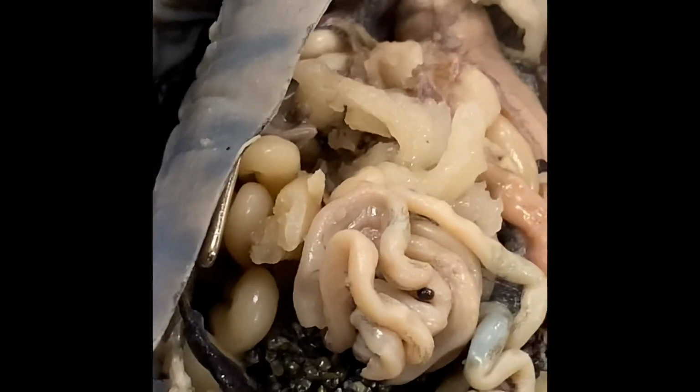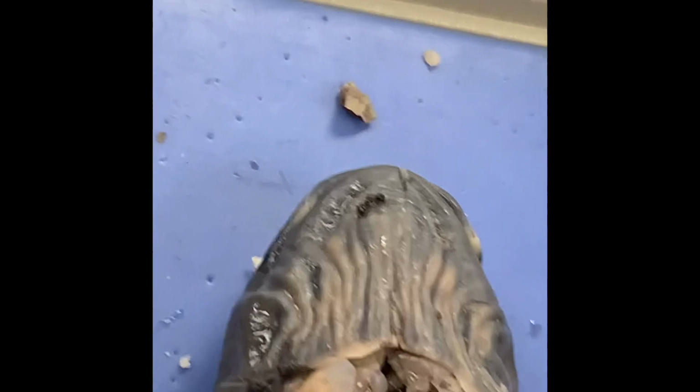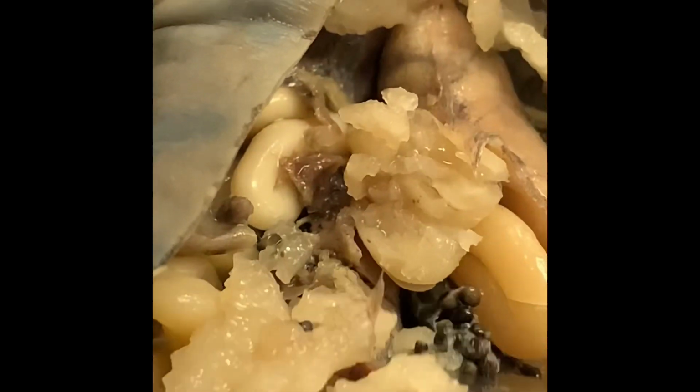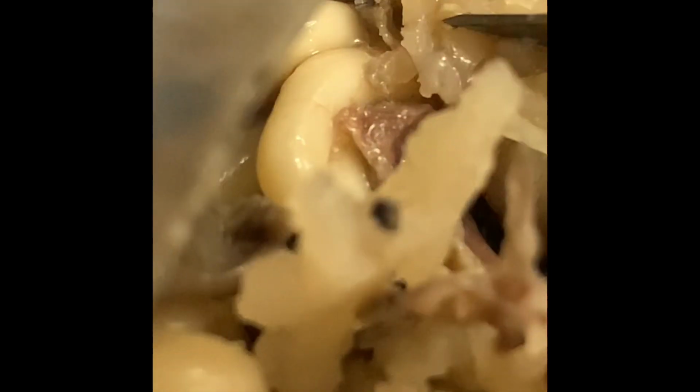You see, like the little... It's like a little brown thing next to the stomach will be the spleen. You can kind of just point anywhere. And here, you point at it with this. So the spleen should be right... See this little brown bit under all the intestines and ovaries. You might not be able to see it that well. Wait, no, I think I got it. The spleen is in there.